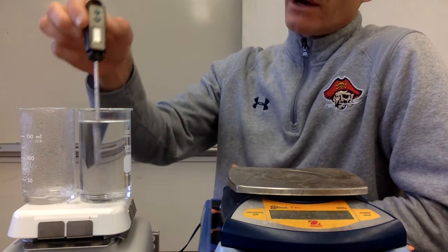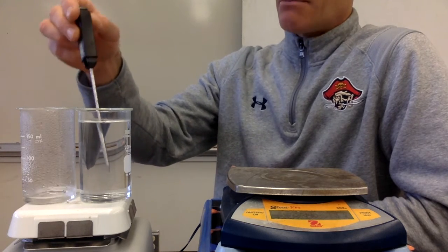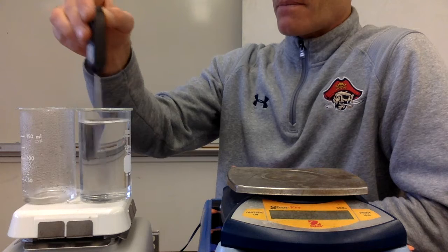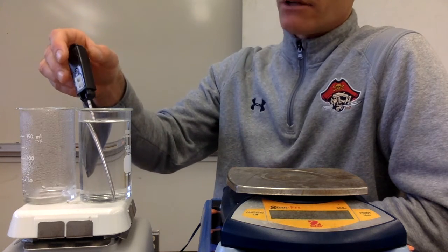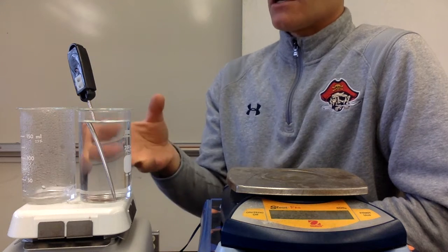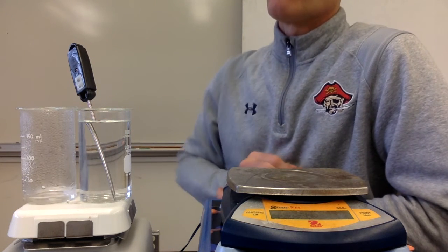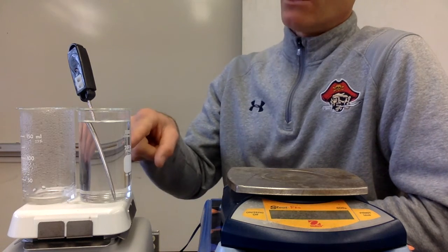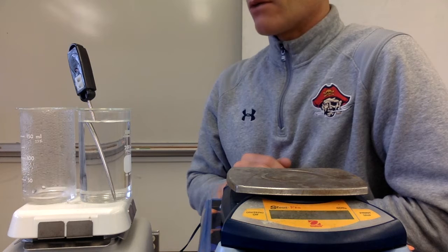There's other ways to find the heat of vaporization. This one is kind of the simplest to set up, and that's why we're doing this one today. But there are other methods that could be used as well. But they all kind of rely on calorimetry, where you have some water that's releasing or absorbing heat, and you can figure out how much heat was released or absorbed by the water, and then set that equal to the amount required to turn the other water to vapor.